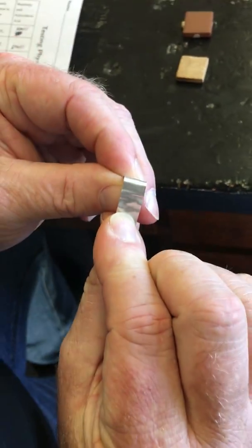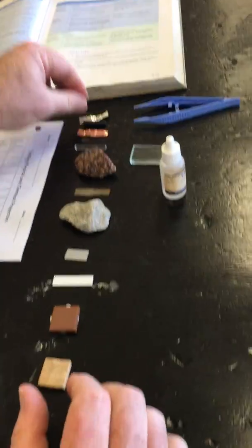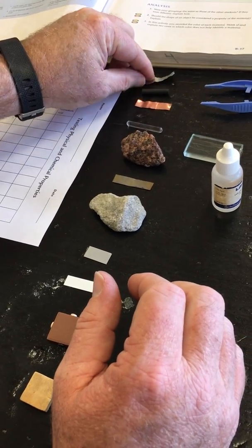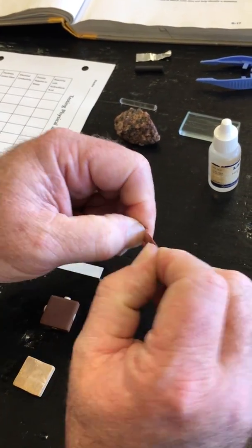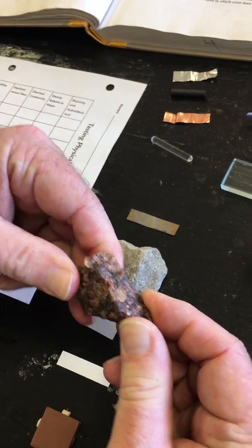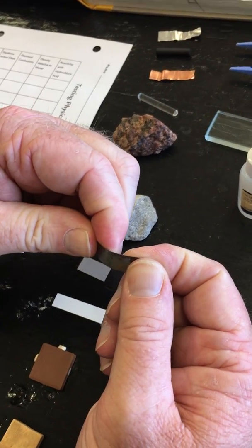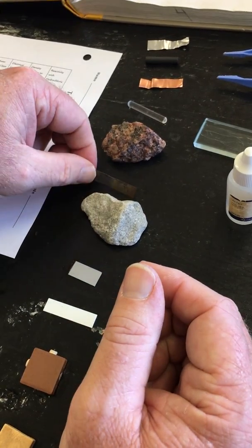Okay, so we'll take a look here at your aluminum. So what do you think there? Okay, my carbon. You'll notice that it doesn't bend at all. This is your piece of copper. The glass rod. The granite. The iron. Okay, that's about the same pressure that I put on the copper and the aluminum.